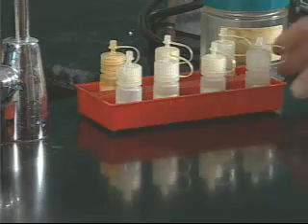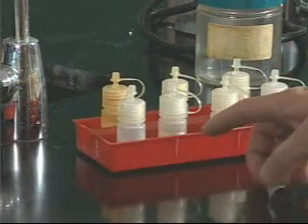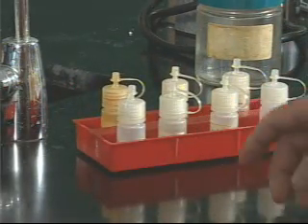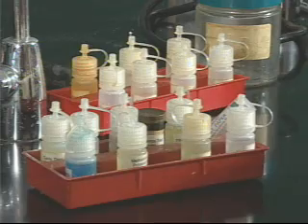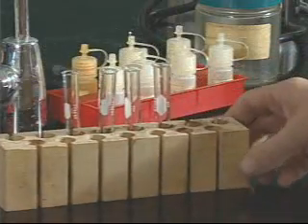On the bench in front of us is a variety of components for this laboratory. We have a set of standards, which are known compounds to test. We have a set of reagents, each one of which is a different reactive compound. We have a set of test tubes that we can use for some of our reactions to carry them out in.